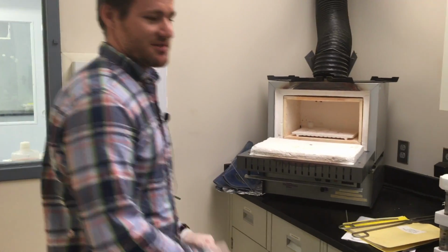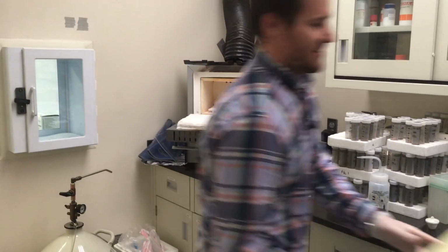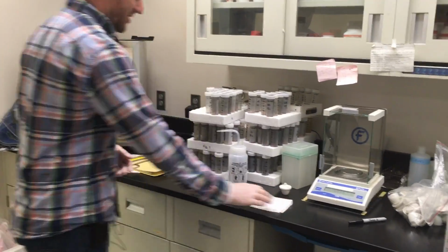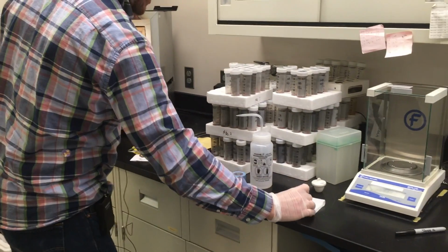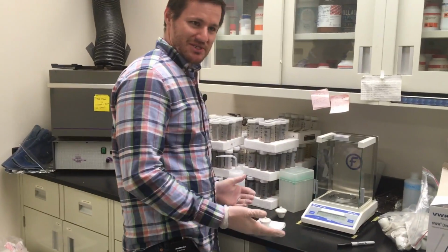So that's where I'll need to look back at my notes and see what sample was in the upper left-hand corner. That was sample S1. What I like to do, as I take my samples out of the asher, as good practice again, is put them back on a chem wipe. And I will remark them, because I'm going to use this sample again. I want to know what sample name it is. I don't have as good of a memory as it would take to memorize 30 samples.